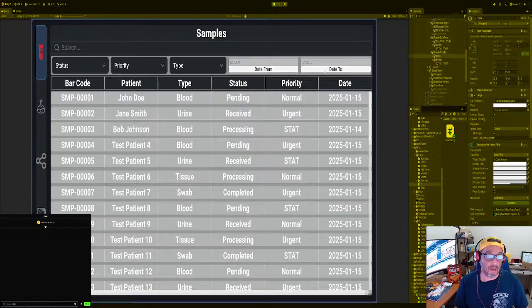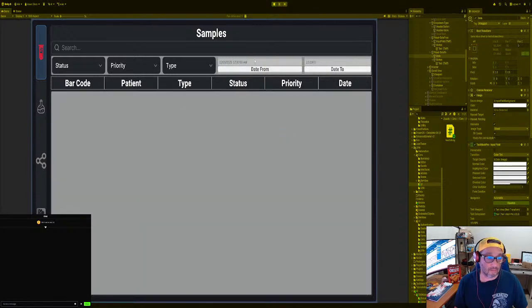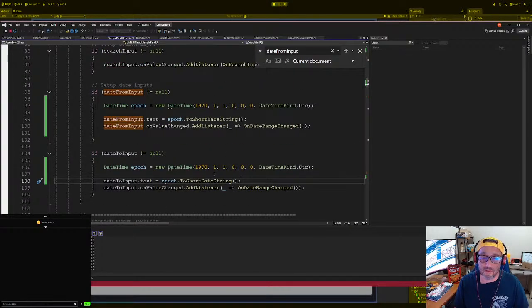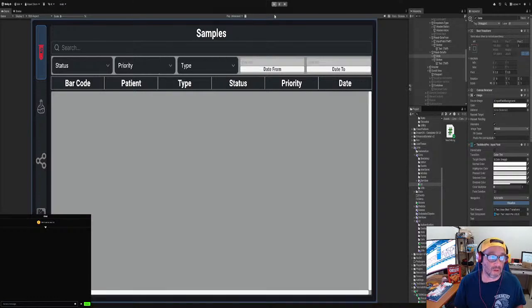Yeah, it's working, right? And so from 19, oh, that's not bueno. From 19, right? Why not? That's 1970 to, I want it to be 2026, right? And then we need to add this up as well. Let's just fix this up as well. All right, and that should be good. Actually, let's just do the whole system instead of a partial system. It's just going to add more bugs. So let's make another calendar.